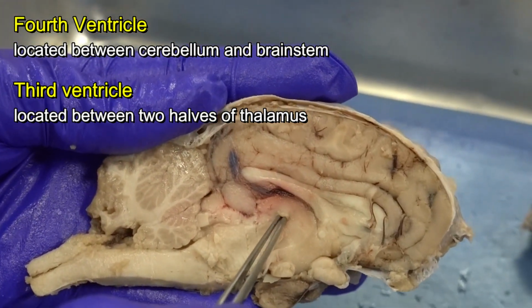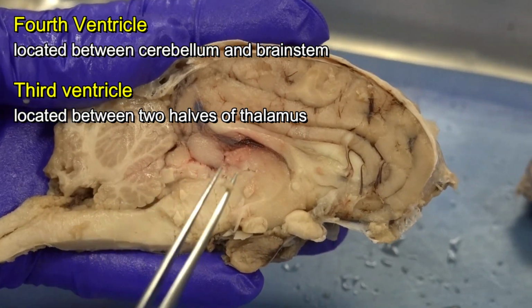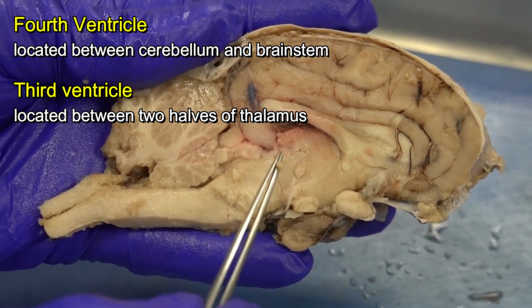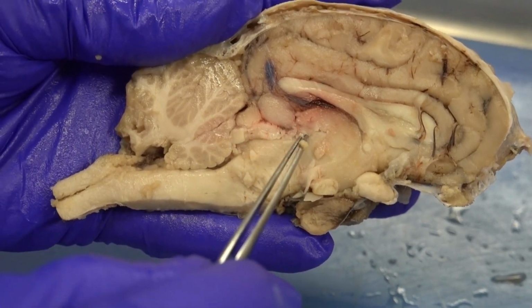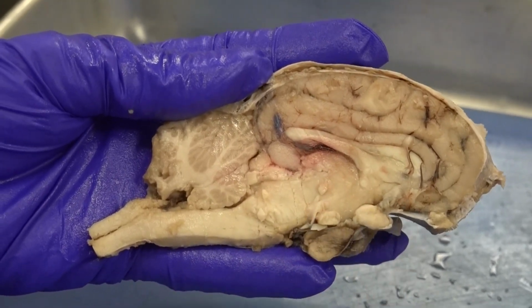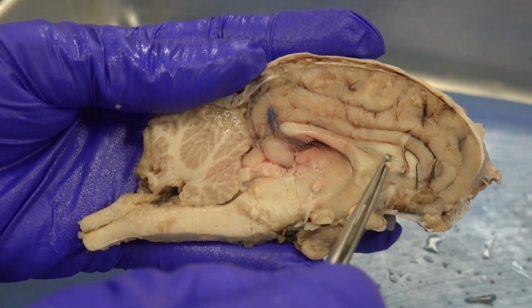So right now I am poking the left side of the thalamus. If I place the two sides of the thalamus together, I see between the two halves of the thalamus, we have a space that is called the third ventricle. So that's the job of the cerebral aqueduct, to connect the third ventricle to the fourth ventricle. And then from the third ventricle, we have two openings. Each one of them connects the third ventricle to one of the lateral ventricles.